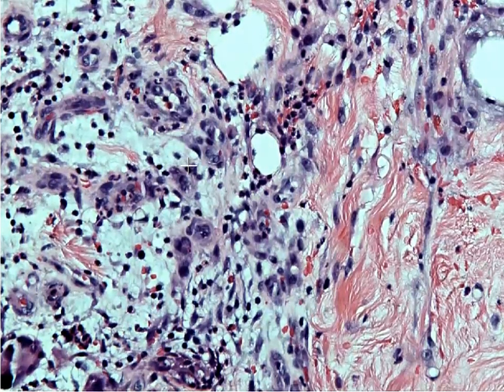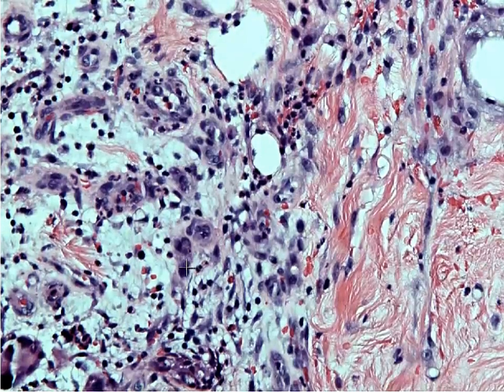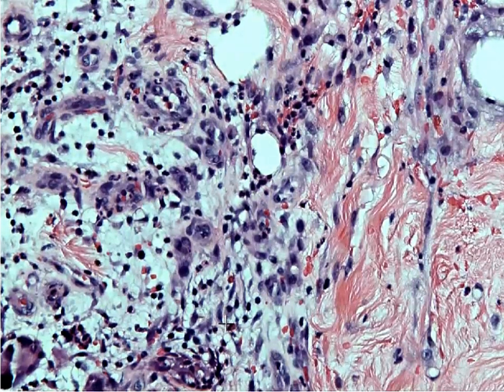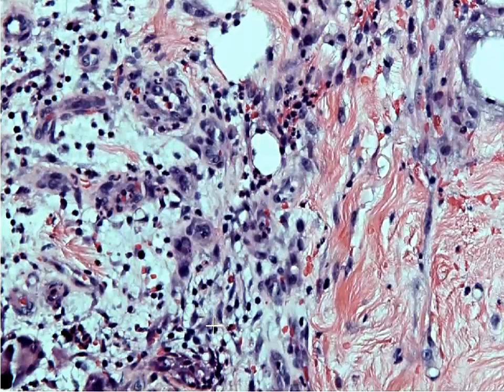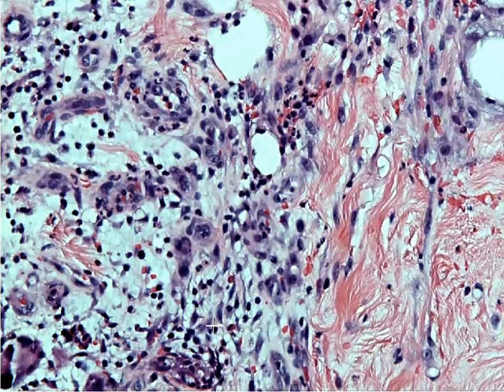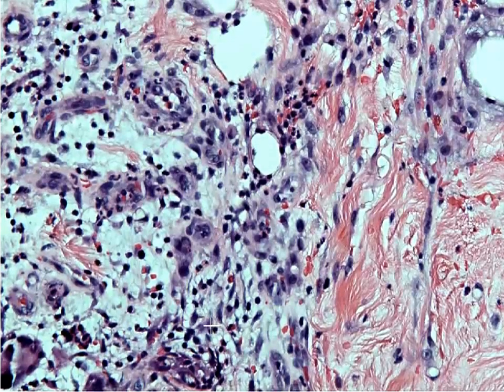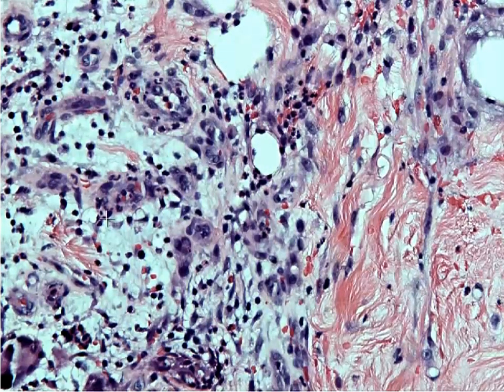In addition, we have some eosinophils present here. You can identify an eosinophil in this area because it is a bright pink cell with what they call sunglasses-type nuclei, where the nuclei kind of look like sunglasses — they'd have to be the big aviator ones.